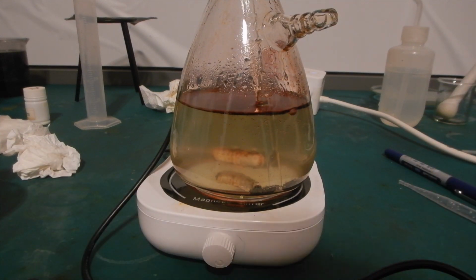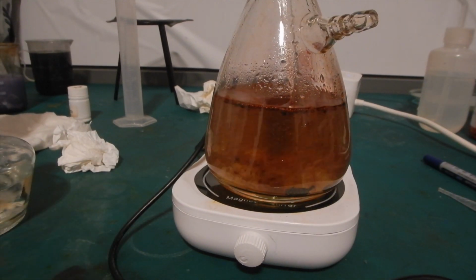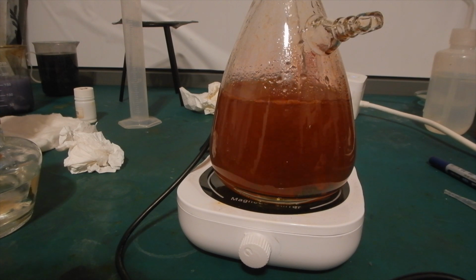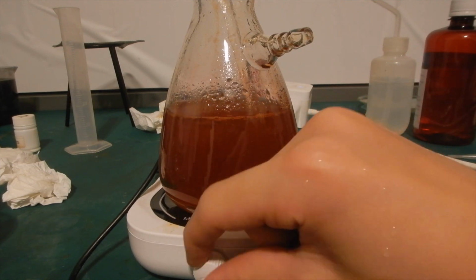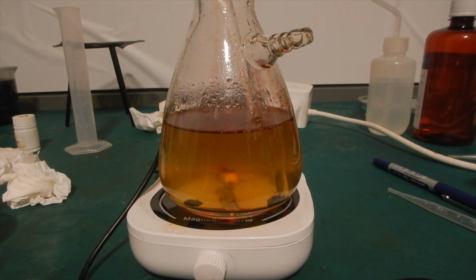When the iodine reacts with hydrogen peroxide in water, it has a relatively small surface area. But when the iodine dissolves in diethyl ether, a large surface area can be achieved by vigorous stirring and letting the two layers mix. This, in turn, made the reaction go a lot faster. Looking back, I should have dissolved all the iodine in ether first, and then added the hydrochloric acid and hydrogen peroxide. That would certainly have resulted in an even better yield and a faster reaction.